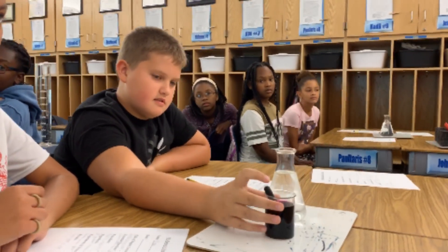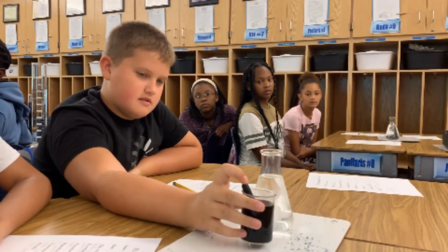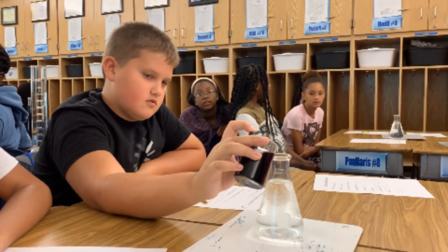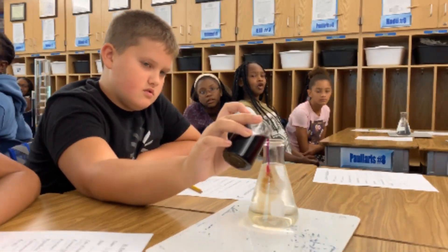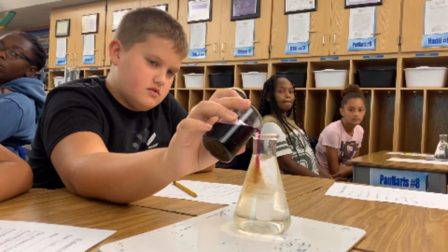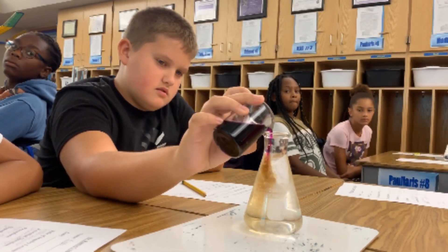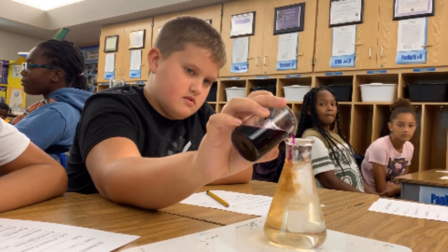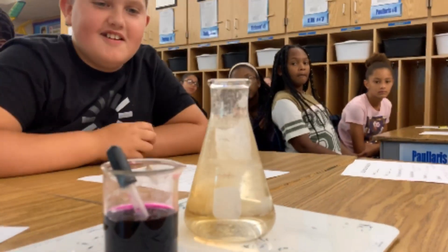Okay, now start pouring more of the beaker into the flask, and let's look at what happens. Look at how the color immediately changes — isn't that bizarre? Okay, stop. Look how clear it is — isn't that amazing?